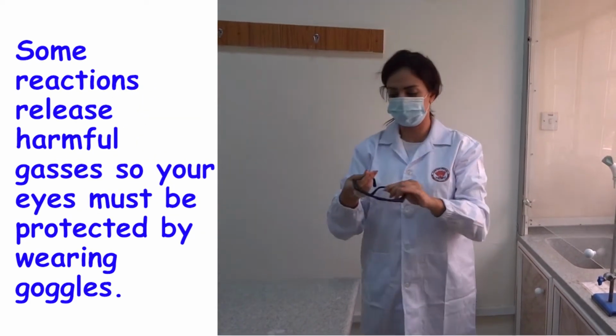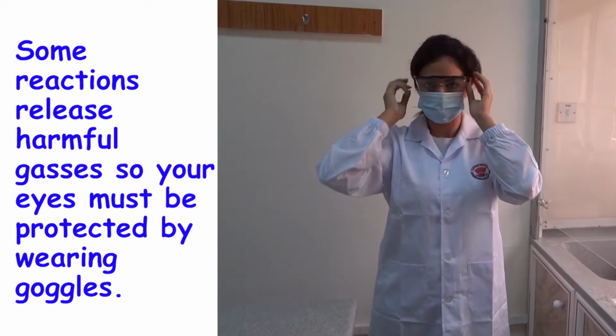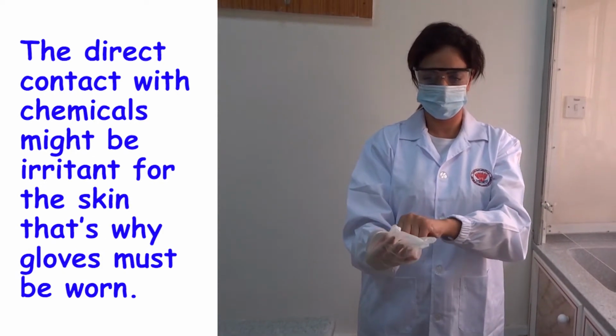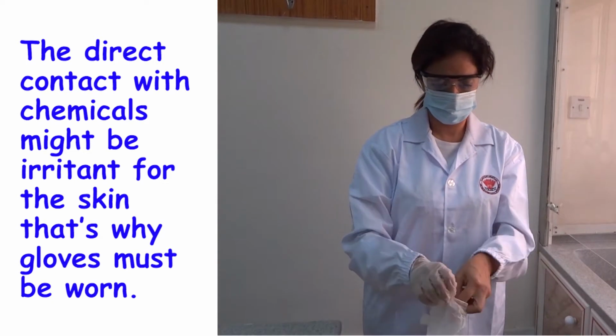Some reactions release harmful gases, so your eyes must be protected by wearing goggles. The direct contact with chemicals might be irritant for the skin. That's why gloves must be worn.